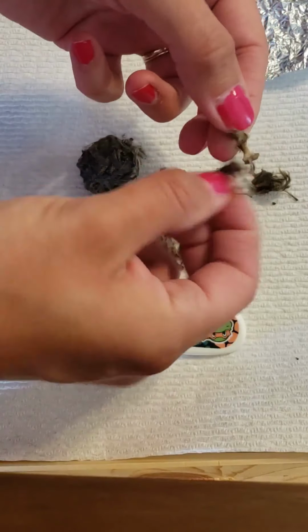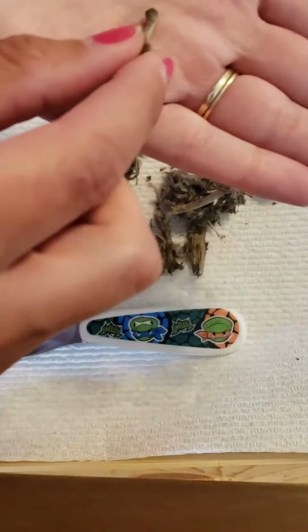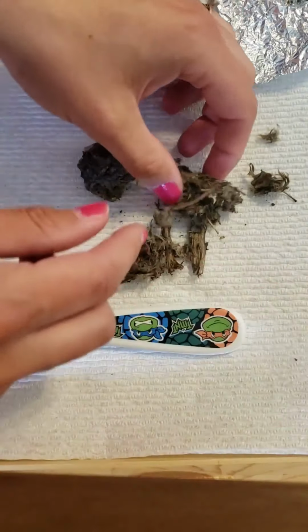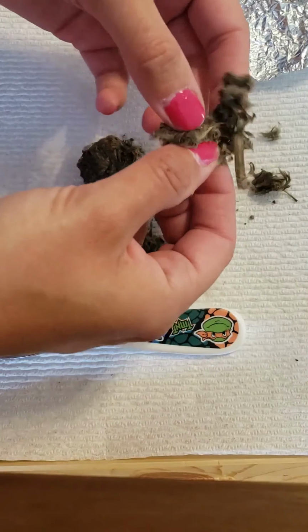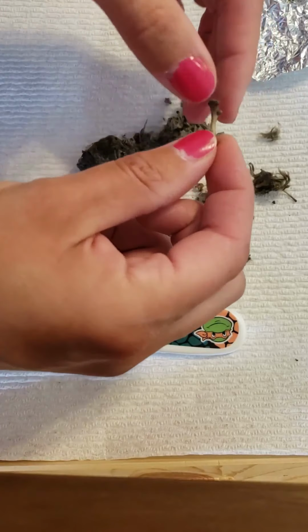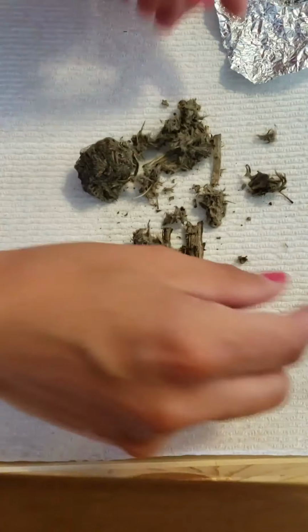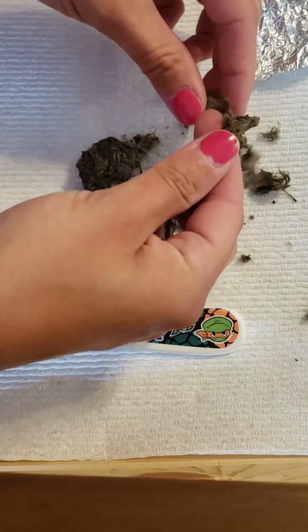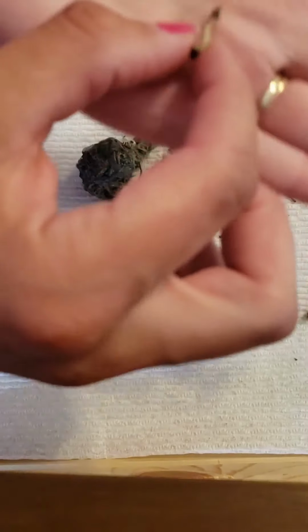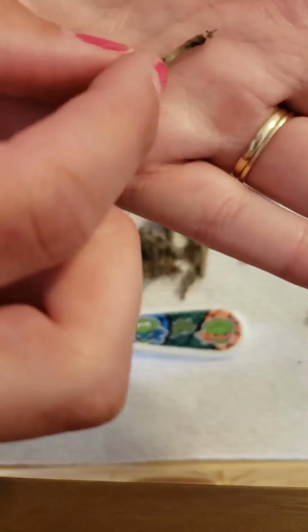So here's a bone. I hope that my phone will focus for you. There we go. There's a bone. We're going to classify that one for sure. Just going to put that to the side. And I can't wait to wash my hands already. Here's another bone. So that's interesting. We already have 2. Ooh, here's a little tiny one. Oh, this is cool. There's a bone. Whoopsie. Let's see here. There we go.